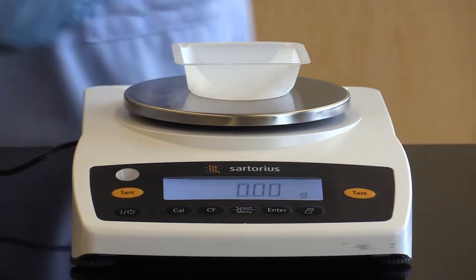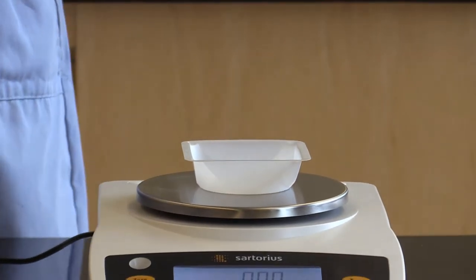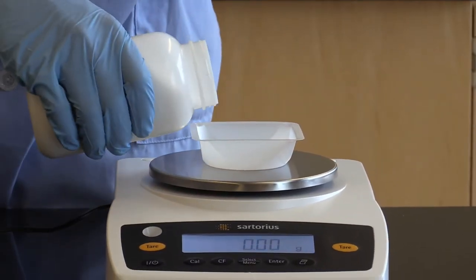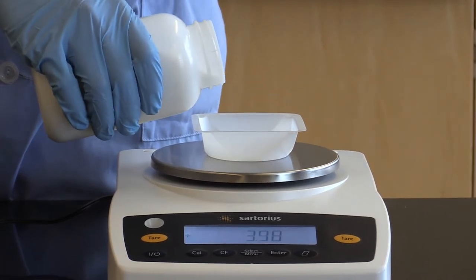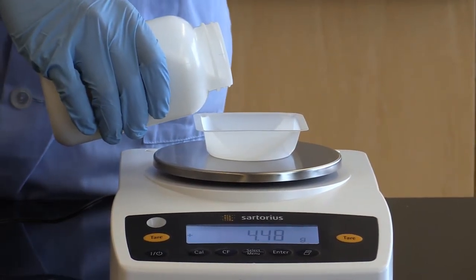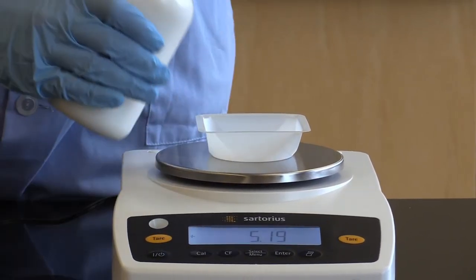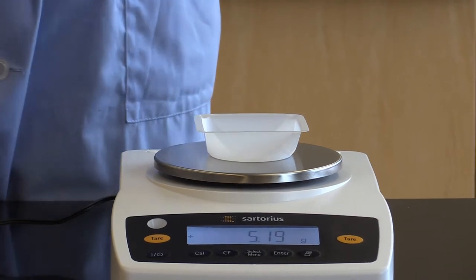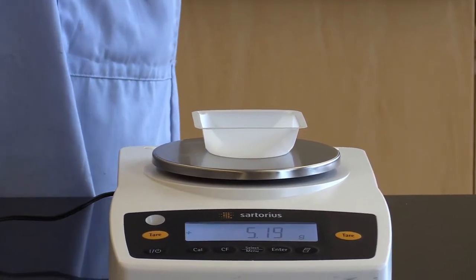Alright, now that it's at 0.00 we can weigh out the sucrose. Remember, we want to get to 5 grams. And we're at 5.19, so for this demo that will be close enough.